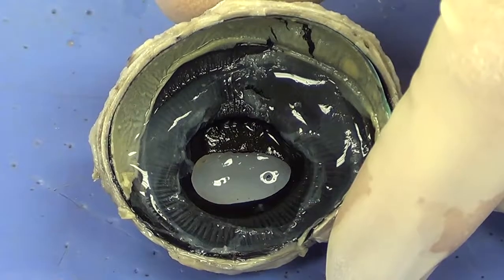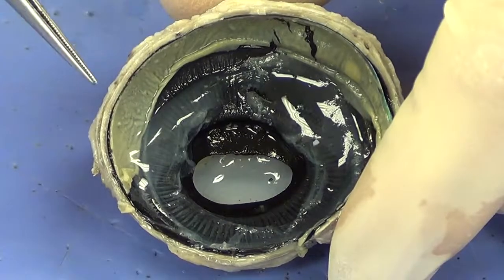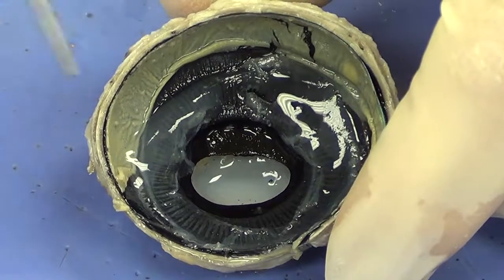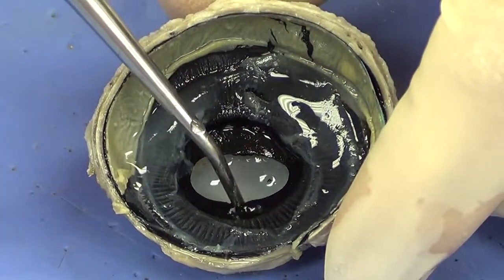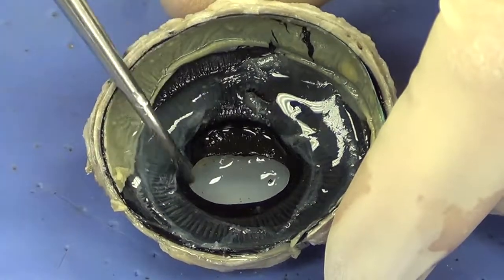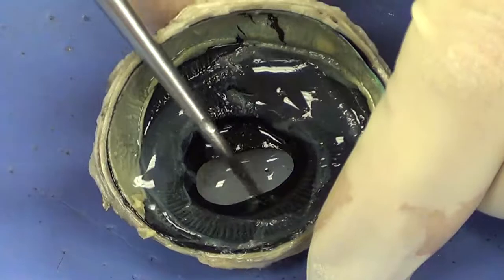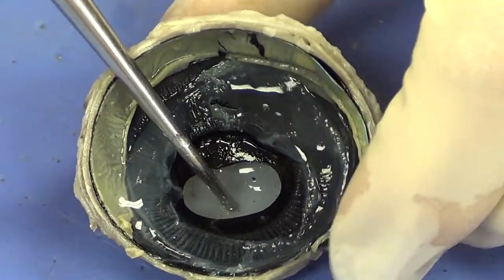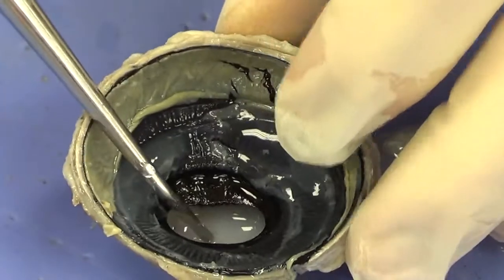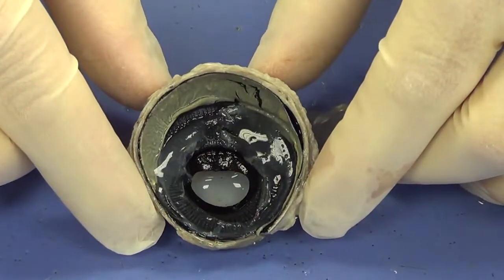During the day you want less light, and at night you want more light. So that iris is actually going to change shape, and it's going to allow this hole here called the pupil to become larger or smaller. That hole in the iris is referred to as the pupil. In cows it tends to be oval, and in humans it tends to be round. And then if I look through that, I see the cornea. That was the structure that we looked at initially right here. That's the cornea. And those are going to be the structures of the eye.